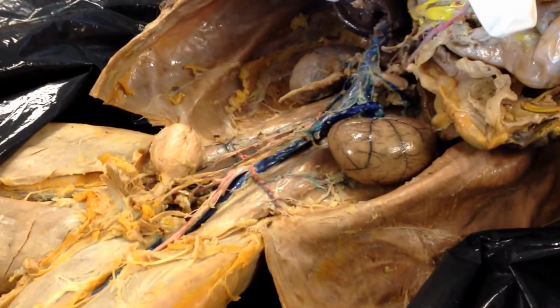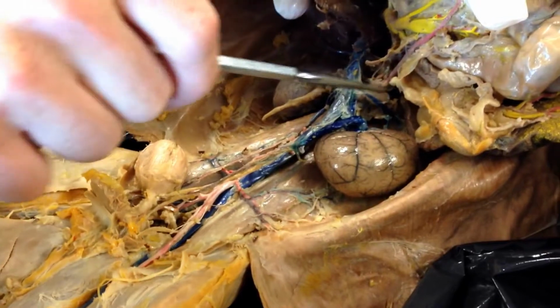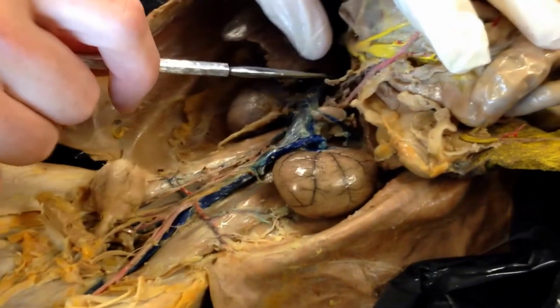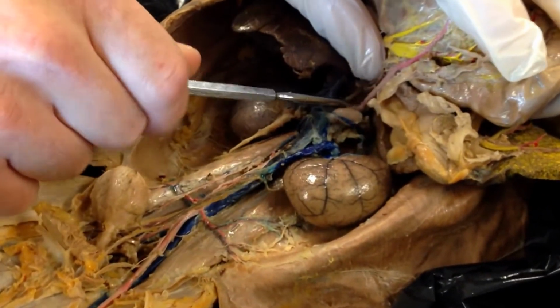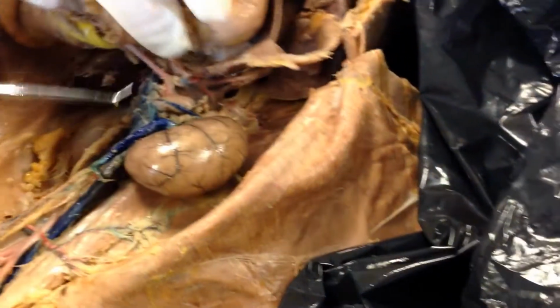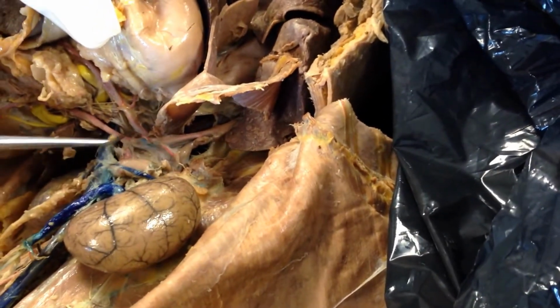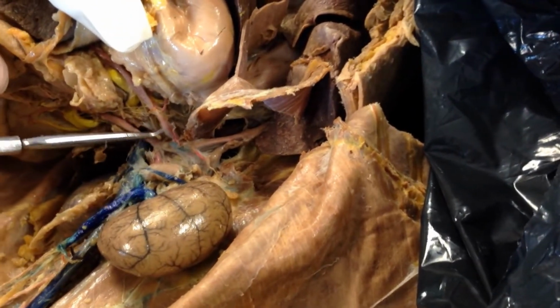All right? The first branch in the abdomen that comes off is called the celiac. So actually, sometimes you can see it from this view down here, and we can kind of see a little bit of it down in here, but it's easier sometimes to roll the whole intestines over. So this branch right here, remember this is the aorta. It's kind of curved here because I'm pulling on it, but this is the celiac artery.